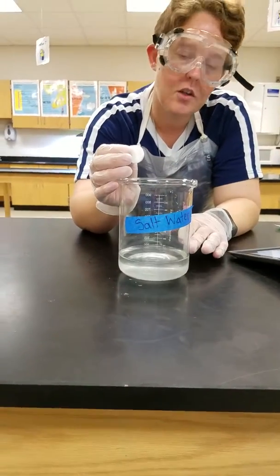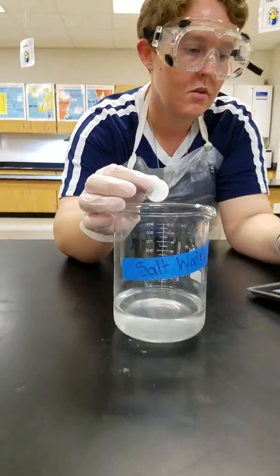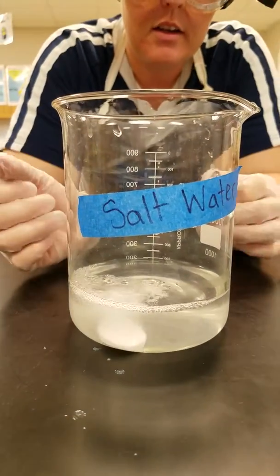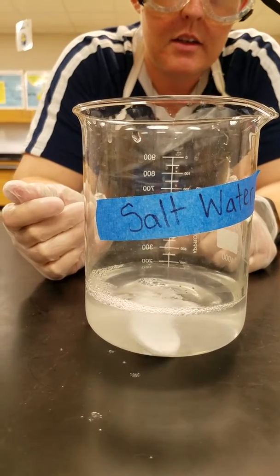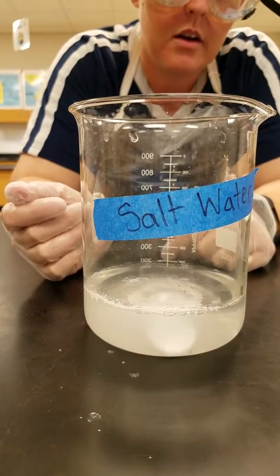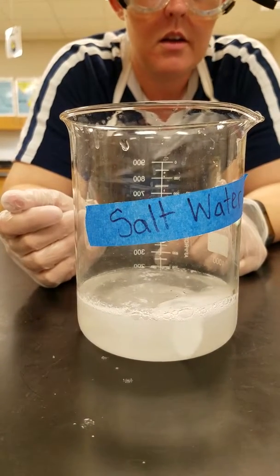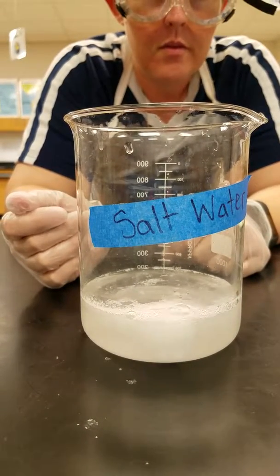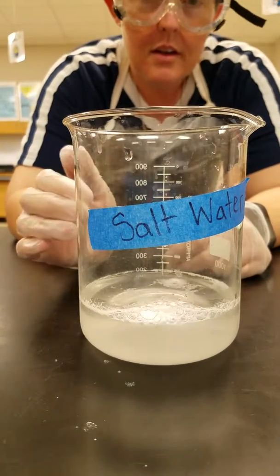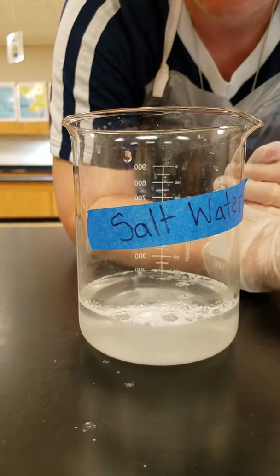I tried to put as much salt in here and stir it up to where it was all dissolved and there was none sitting on the bottom. 3, 2, 1, go. Got a little splash on that one. Alright. So if you notice, this one definitely looks slower than our acidic water, and maybe even a little bit slower than our control. And there's some stuff just on the top, little pieces of the tablet that are just not going to combine with the water because there's salt in there.